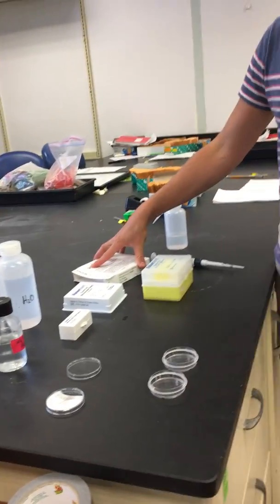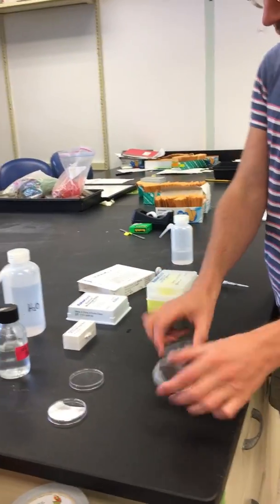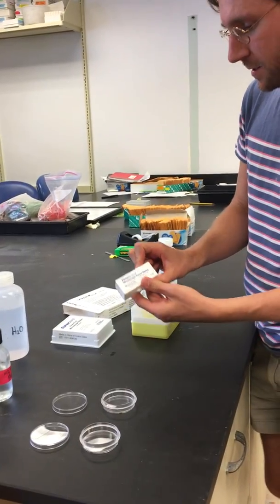The things required for this are petri dishes and microscope coverslips.